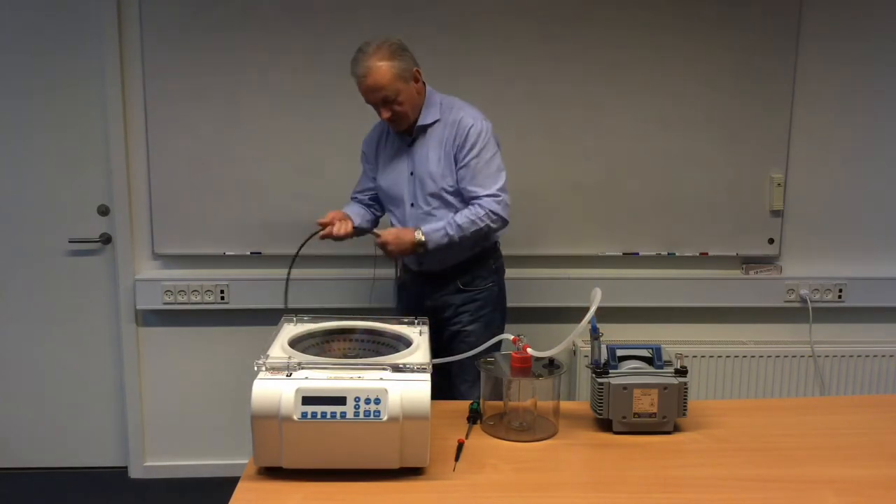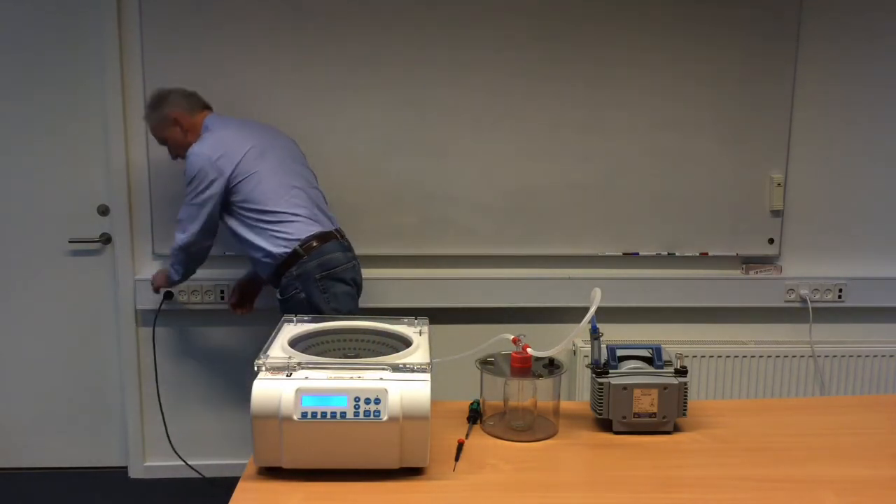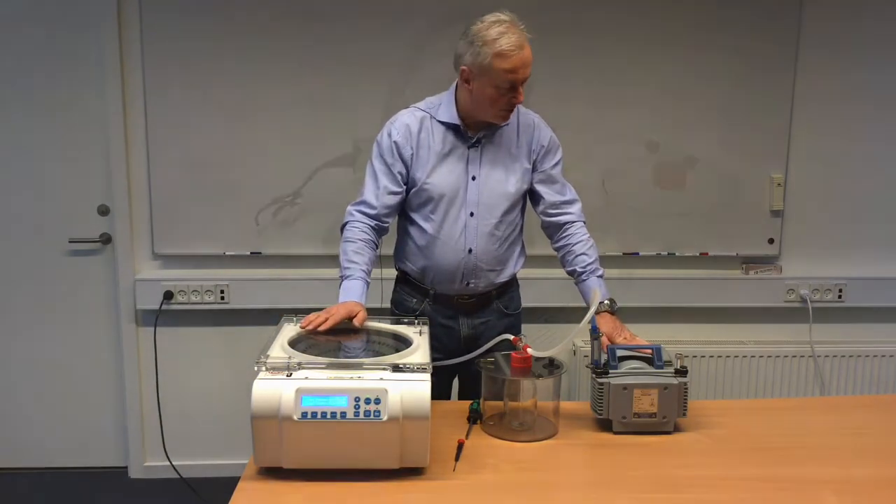Power to the unit is then attached to the main power, and we now get power into the unit. It is in fact ready for operation.